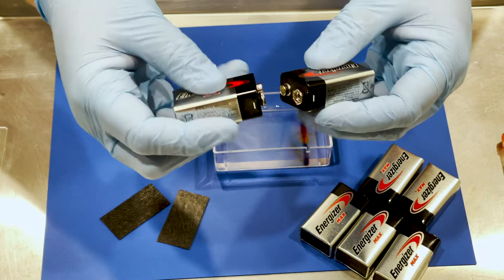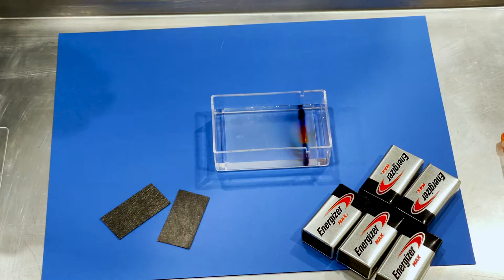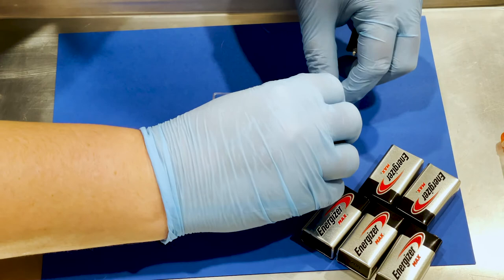Next, you want to get your 9-volt batteries. It says to use three to five. If you use three batteries it will take approximately three hours. If you use five batteries it will reduce that time to about an hour. My gel actually ended up taking about 45 minutes, but you don't want to use more than five batteries.